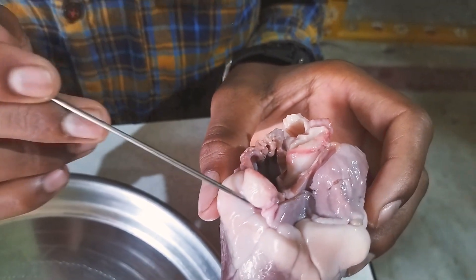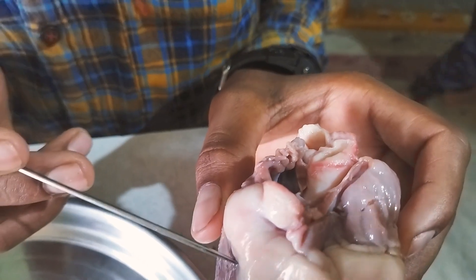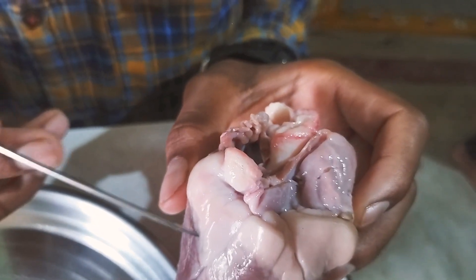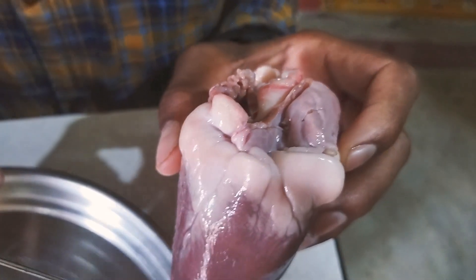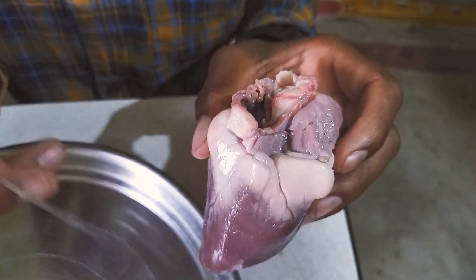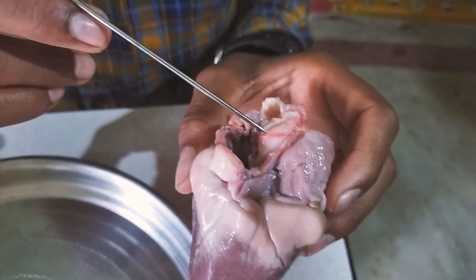The superior vena cava brings deoxygenated blood from all our body parts. This blood goes to the right atrium. From the right atrium, it travels to the right ventricle, and from there the blood goes to the pulmonary artery.